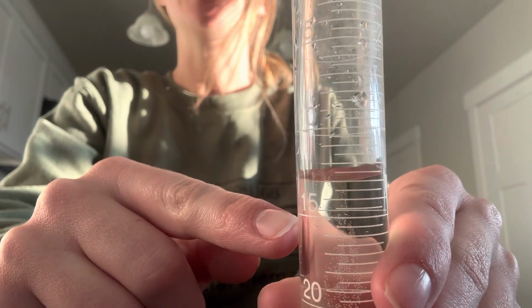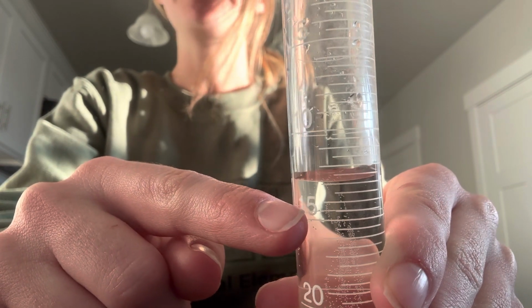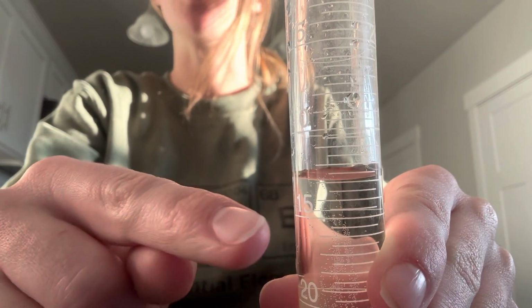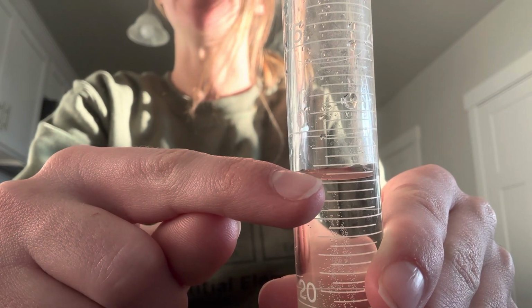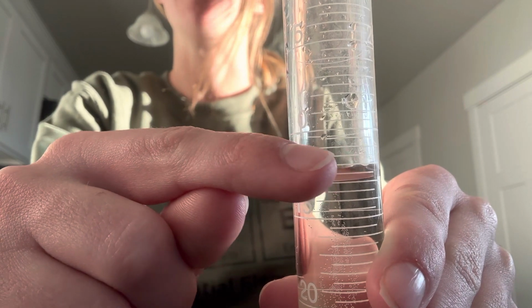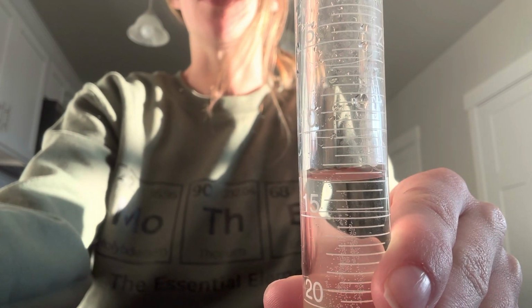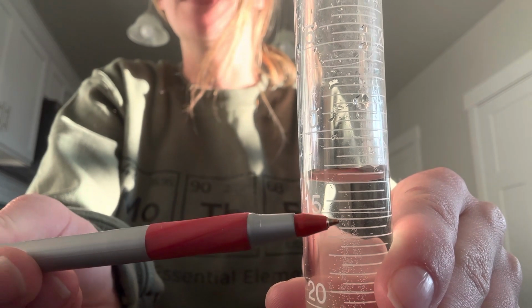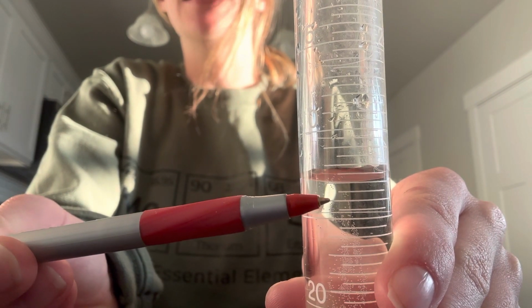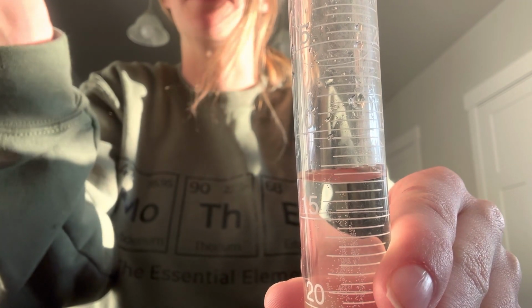The other thing with these graduated cylinders is that here are the big numbers on the side. So this one's like 15. Each little line is a half. So it's 15 and then 15 and a half, 16, 16 and a half, 17, 17 and a half, 18, 18 and a half, 19, 19 and a half, and then 20. So each one is a half mark. The ones that are a little bit longer are full marks. So you can tell that this one's 15, like the big one at the bottom. Then the little line is the half, and the next kind of longer line is 16. So each longer line is like an actual number.